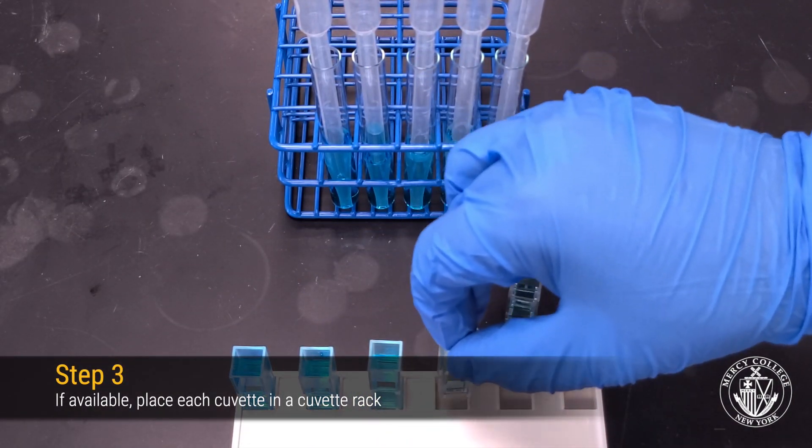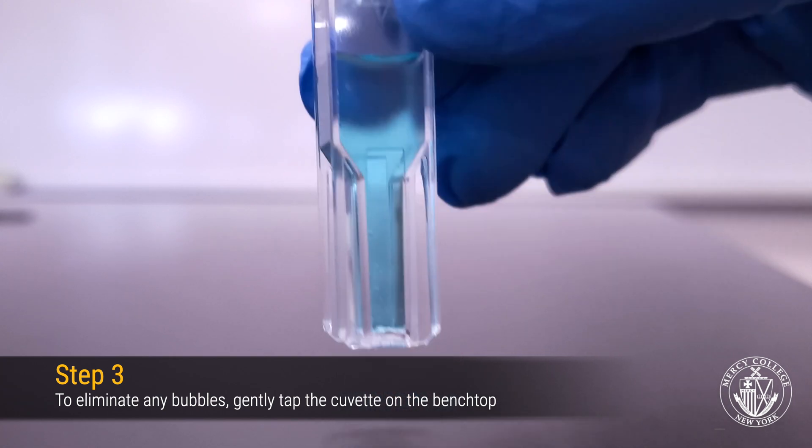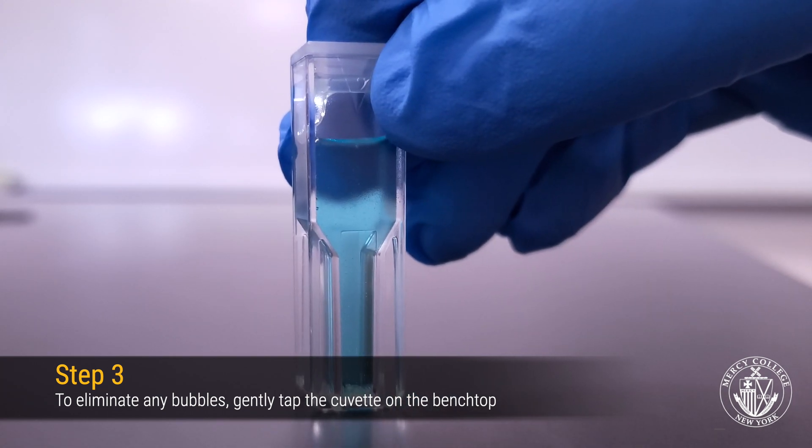If available, transfer your cuvettes to a cuvette rack for easy transport. If any of your standards appear to have bubbles in them, you can tap them against the bench top to remove the bubbles.